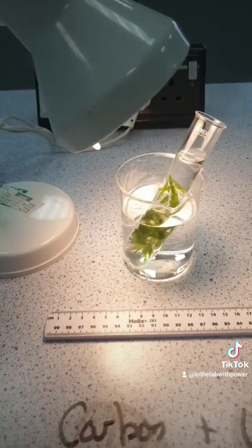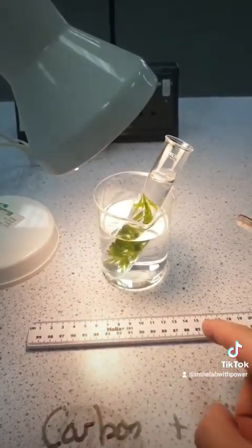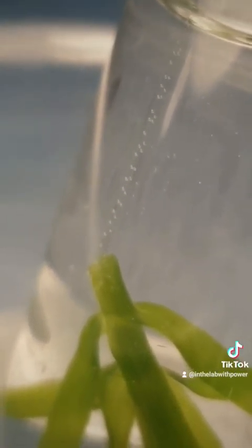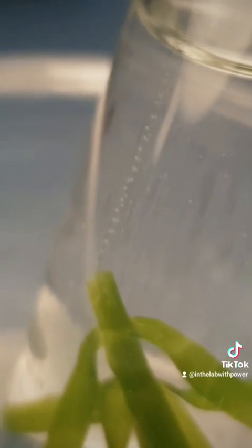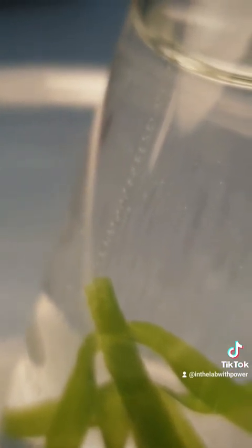So our first trial is looking at a distance of 10 centimeters between the source of light and our Elodea. And we can see that when the light is close and the light intensity is very high, there is a lot of oxygen being released. Typically, we would count these per minute, and that would show us how many bubbles of oxygen were being produced per minute.